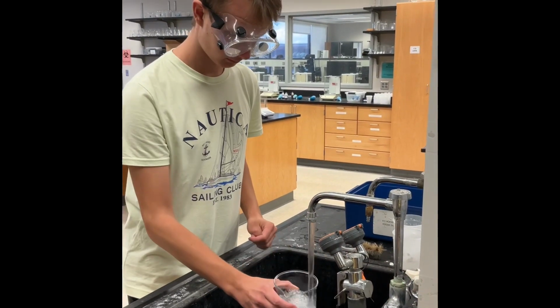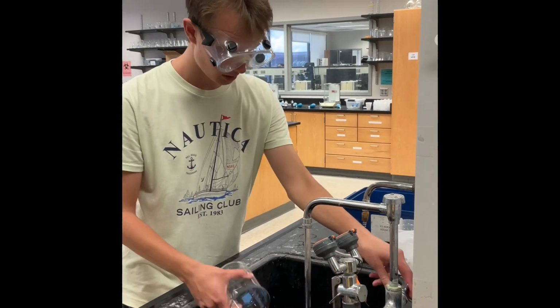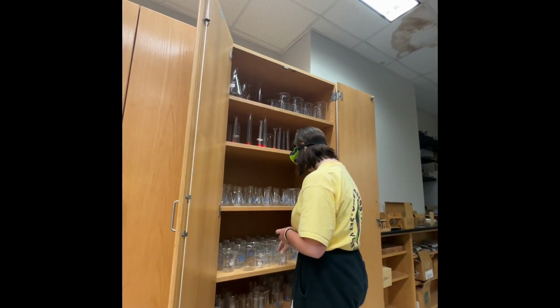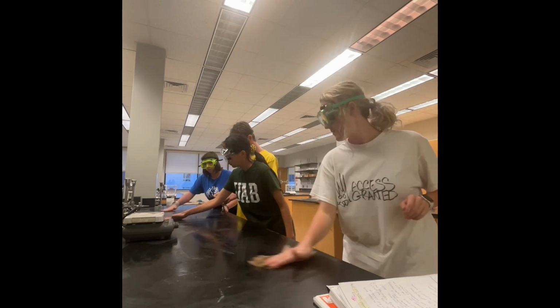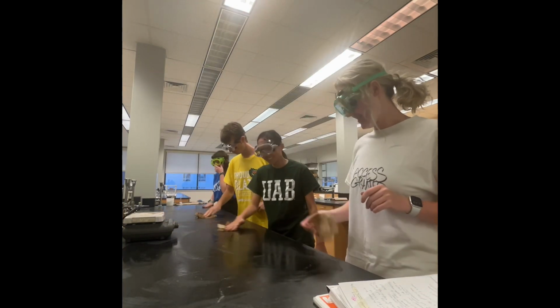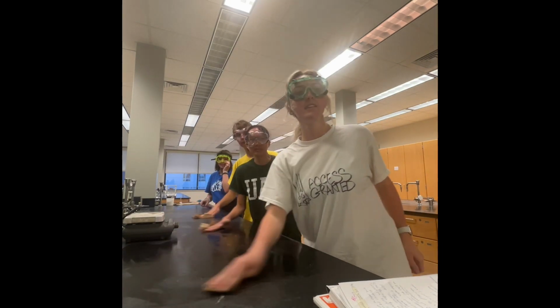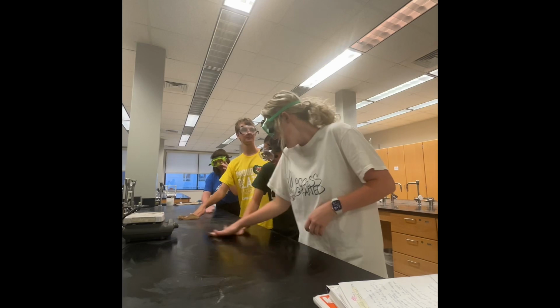After disposal, we cleaned, dried, and put away materials in their proper areas. We then followed up with wiping down the lab experiment area with paper towels and water. Note that this is not how one cleans up every single lab experiment, so follow up with your lab proctor for specific cleaning instructions. Lastly, remember to keep your goggles on until you leave the lab room.